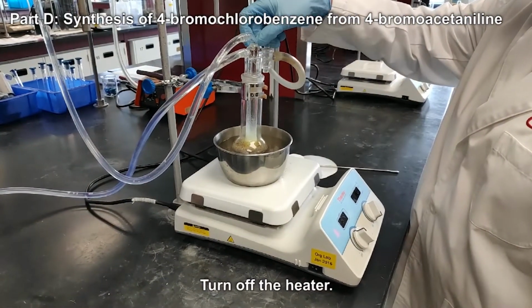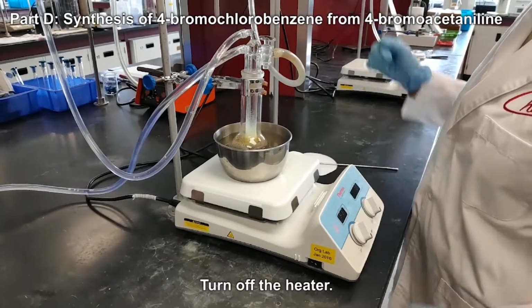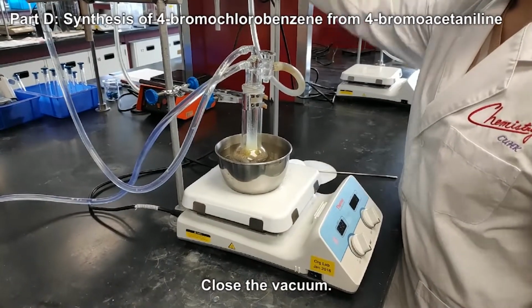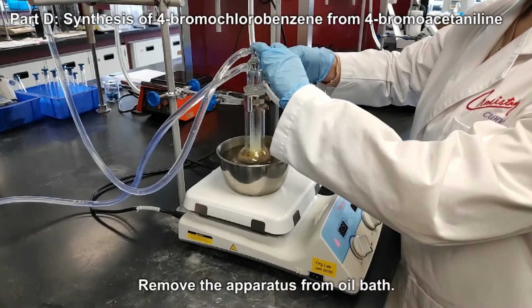Turn off the heater. Close the vacuum. Remove the apparatus from the oil bath.